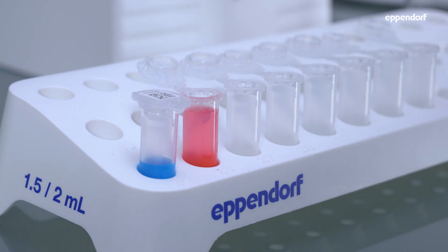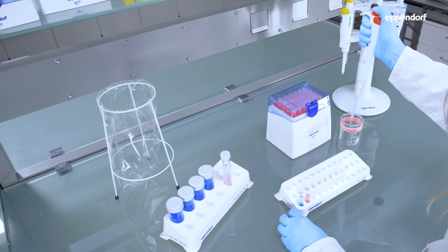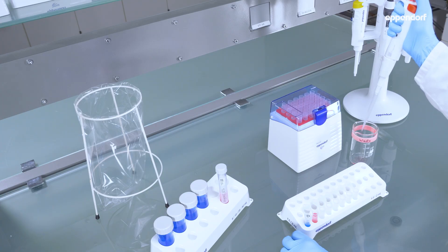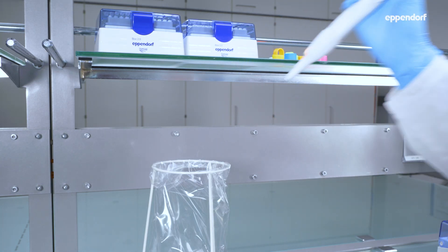When using reverse pipetting, you might want to blow out the residual liquid in the tip into a separate liquid waste container before ejecting.